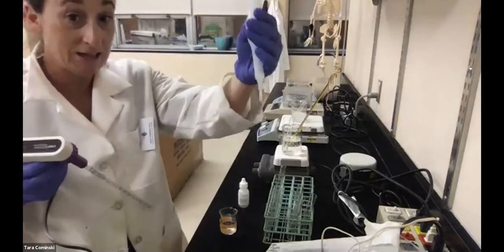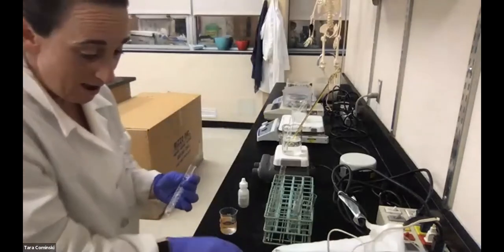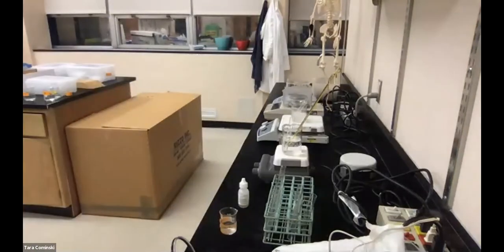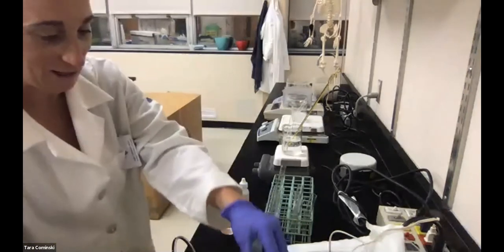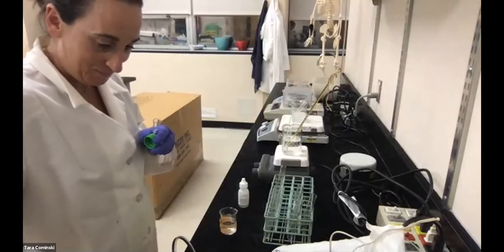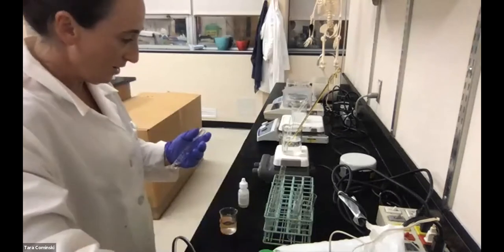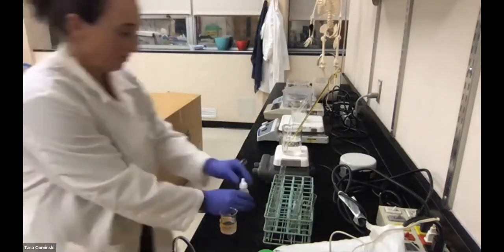Whoa, look what happened there. So there's my bubble height, which was a ridiculous amount. And now it just went into, wait a second. It just went into my, well, wow. I was worried that the catalase wasn't gonna work, so it must be. So let's try that again. I'm gonna add a smaller amount, I guess. You know why? Maybe my test tubes are not big enough, but that's right.